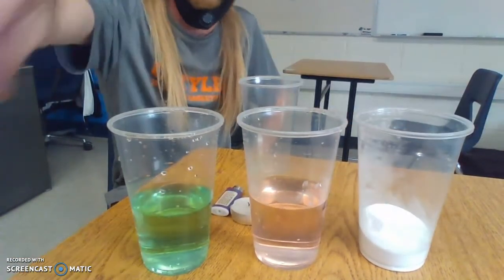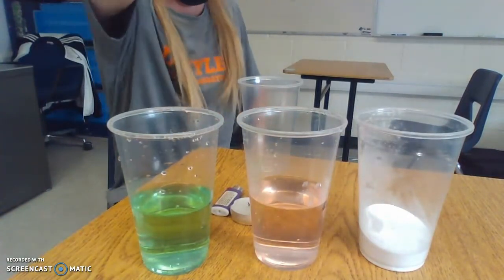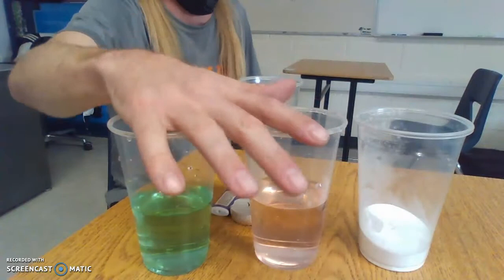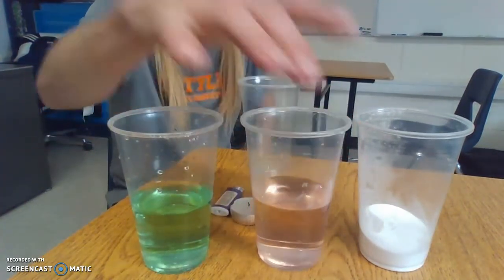So you guys digital people, I've got a class in here, they just did it. So people in class, which of the cups actually made a reaction? Green. Green and what? And the solid.